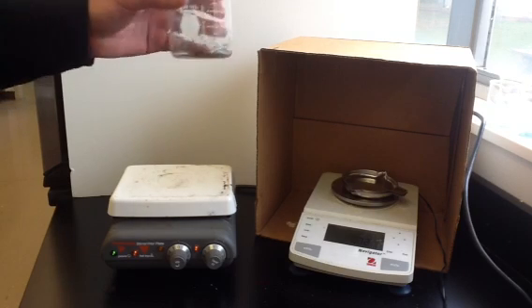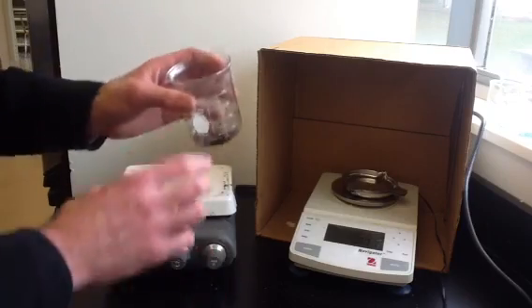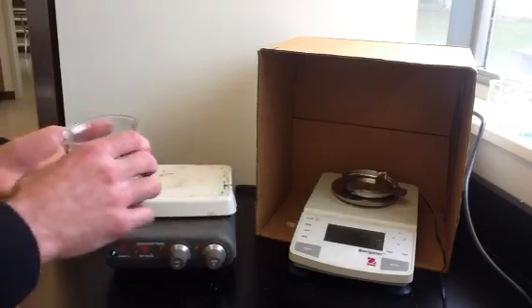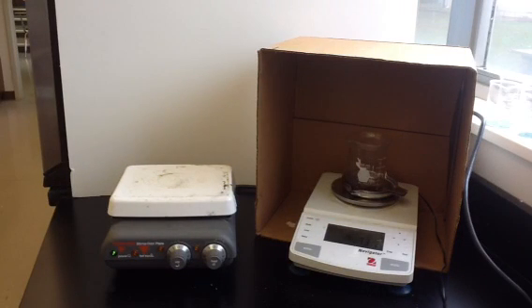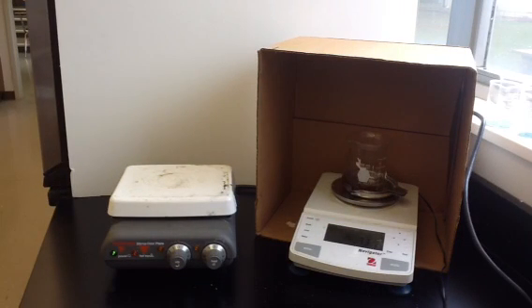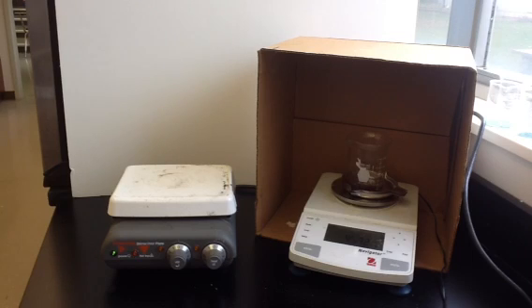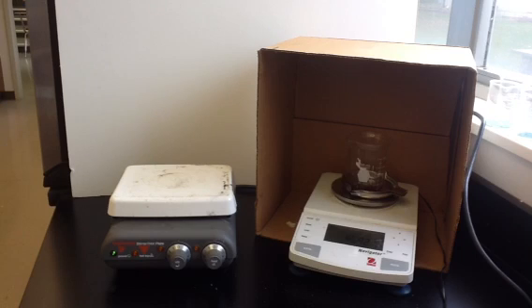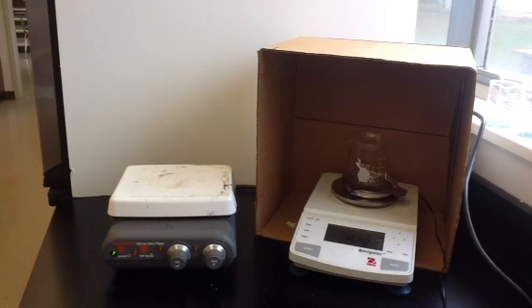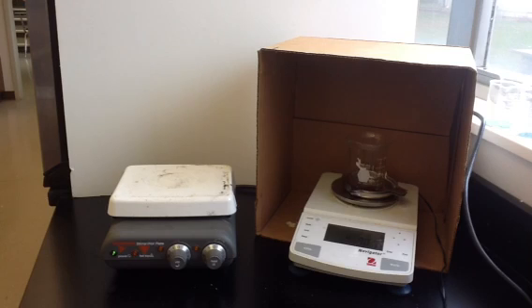It's dry — we've removed most of the liquid, most of the water, most of the acetone — so now it's ready to be weighed. We put it on our balance and get a mass of 95.93 grams. You'll subtract out the mass of the empty beaker, then compare that to the calculations you did in the pre-lab, and see if iron 2 sulfate or iron 3 sulfate was being produced.